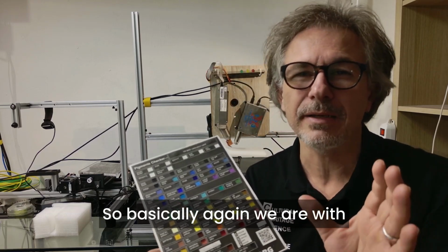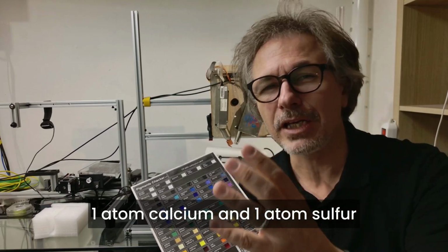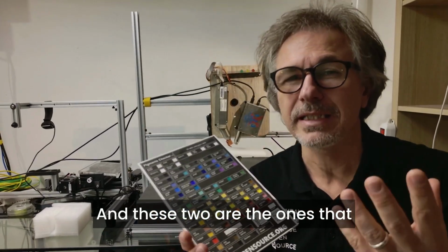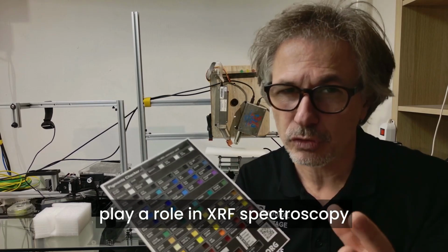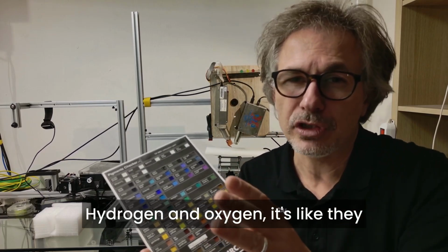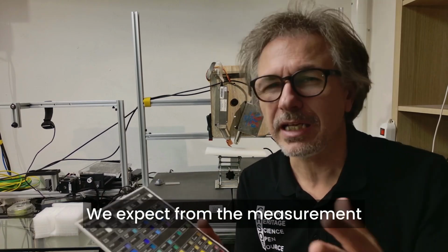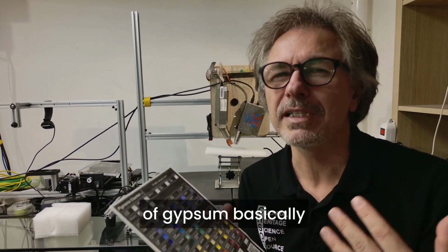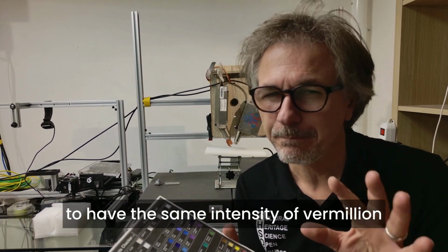So again we are with one atom of calcium and one atom of sulfur, and these two are the ones that play a role in XRF spectroscopy. Hydrogen and oxygen are like invisible to the XRF. We expect from the measurement of gypsum to have basically the same intensity as vermilion.